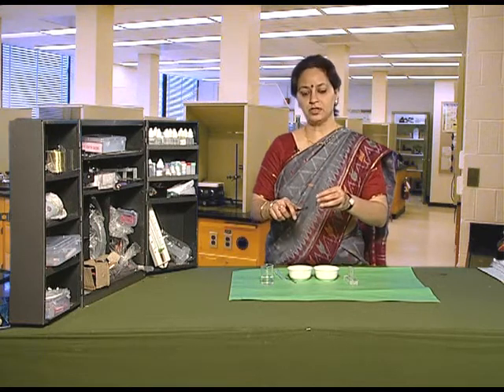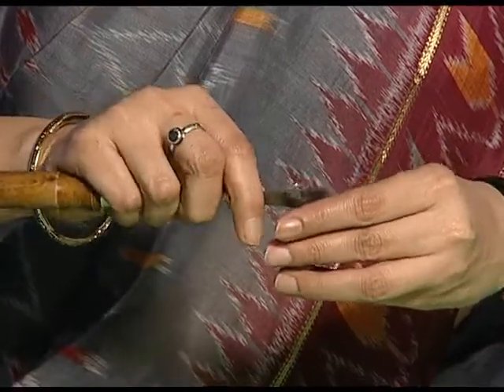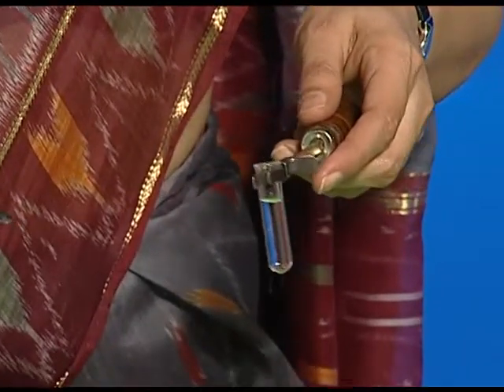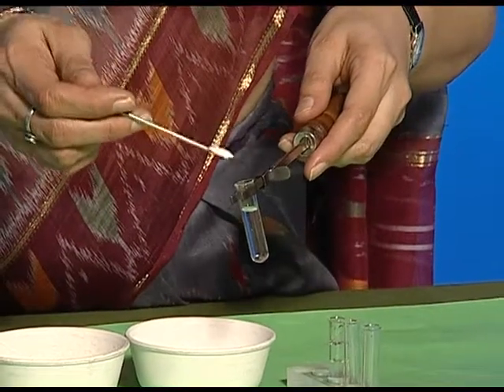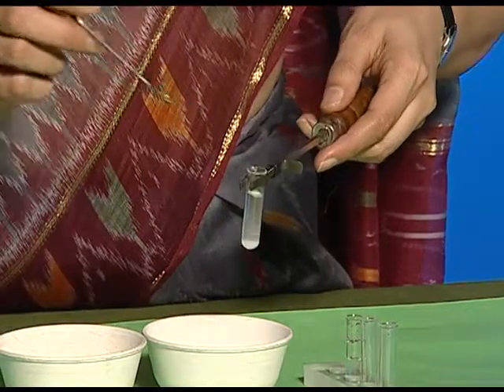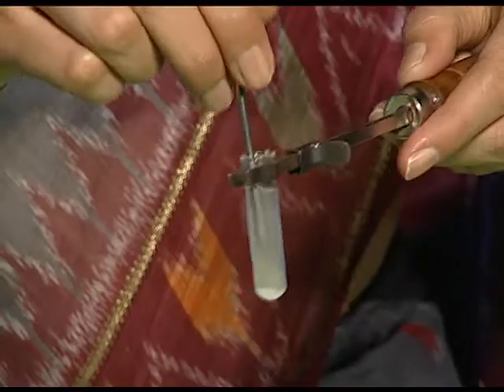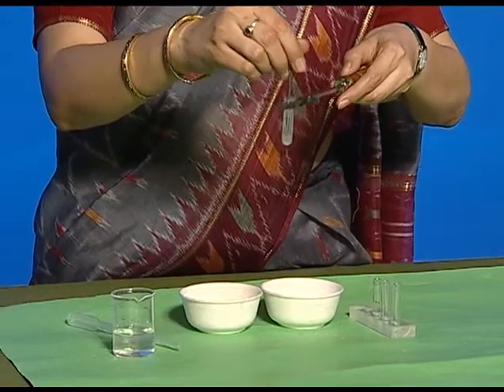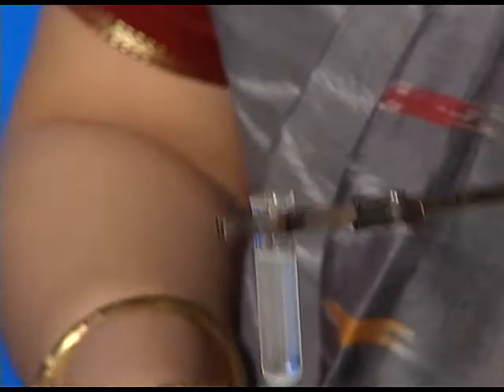Now in the first test tube, we'll take the first solute — that is salt. Add a spatula of it and stir it. You can see that the salt has completely dissolved in water.